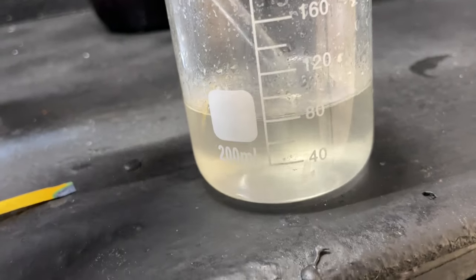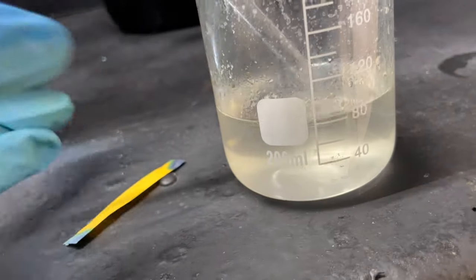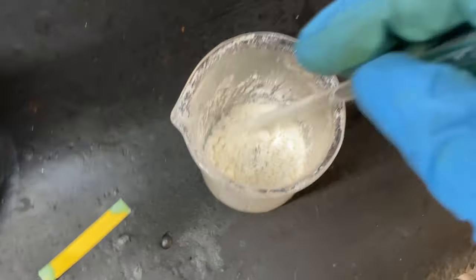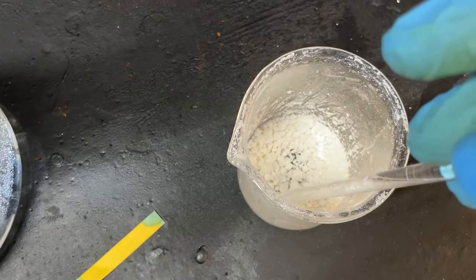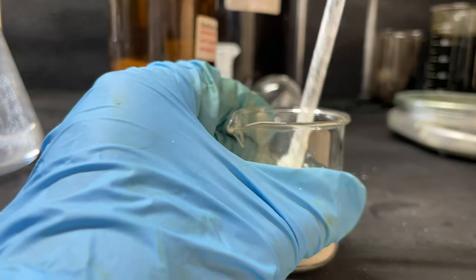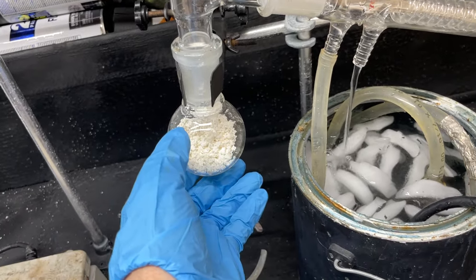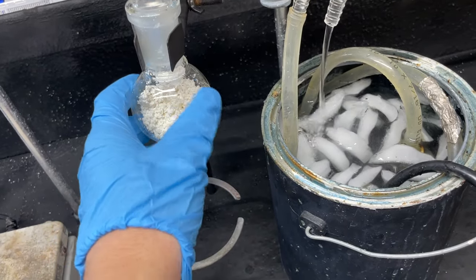We'll probably get a little bit of sodium hydroxide too because the solution is still very alkaline, but that's fine — we're going to need sodium hydroxide anyway to turn it into benzene. Here's our final sodium benzoate. It's not much, but it should be enough to get a very tiny amount of benzene. We need about 10 grams of sodium benzoate, and I went ahead and mixed it with 6 grams of sodium hydroxide. The distillation is all set up and ready. It's not preferable to use glass for this because it will etch the glass pretty well — nothing mission critical will be able to be used in this round bottom again, but it was cheap.